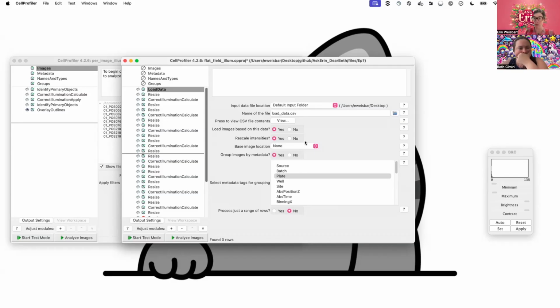It just moves around your plate, your sample, whatever. So it also probably shouldn't be like, oh, I went and I found the most beautiful cell and I took a picture of it. This is something that's much more used for high content automated microscopy, not a manual, I'm looking for the prettiest. This is a thing at scale. And if you have the lower content manual, I'm looking at just the pretty thing, that would be more an instance where you would do things in the wet lab to get the corrections there.